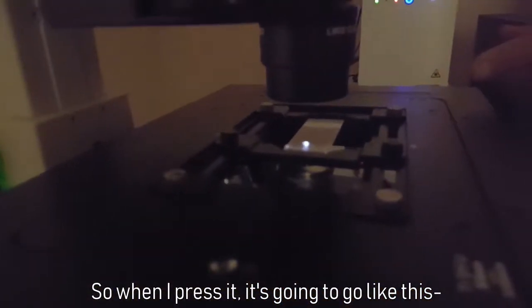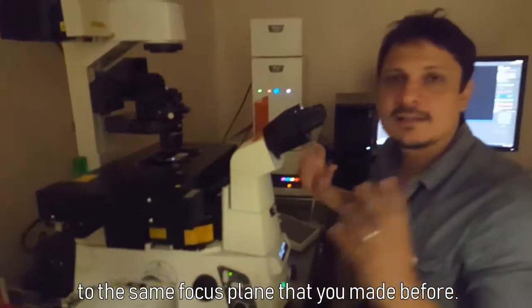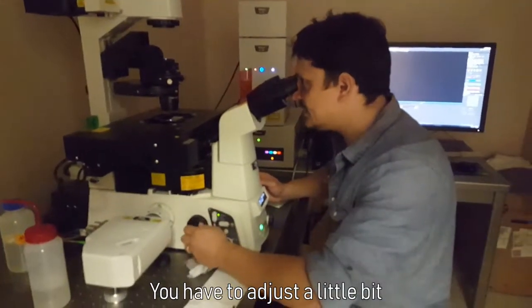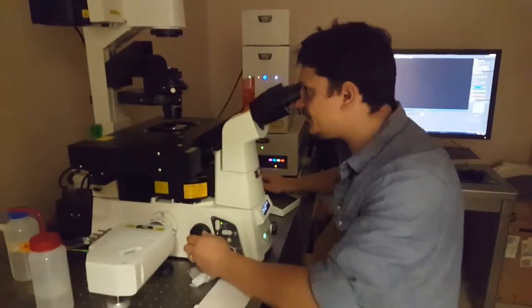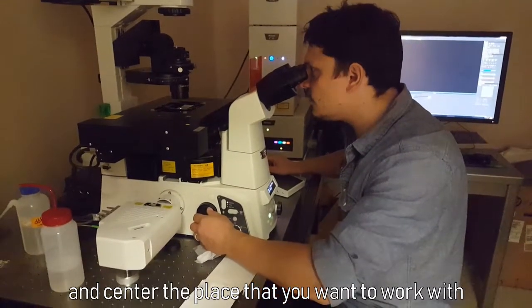So when I press it, it's going to be like this, and it's going to be close there to the same focus plane that you made before. You have to adjust a little bit and center the place that you want to work with.